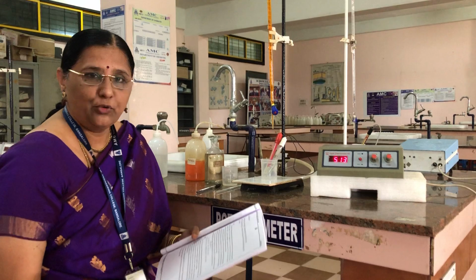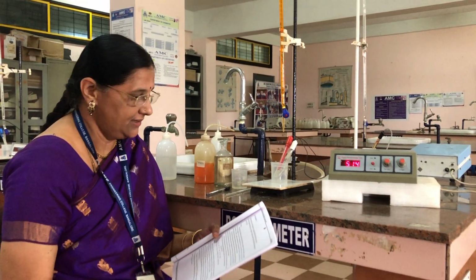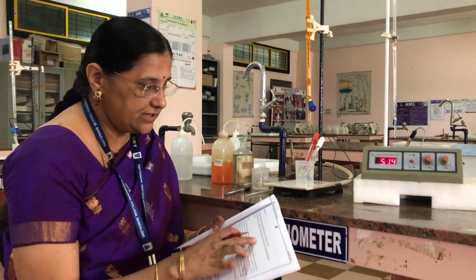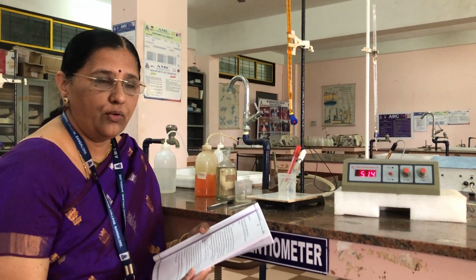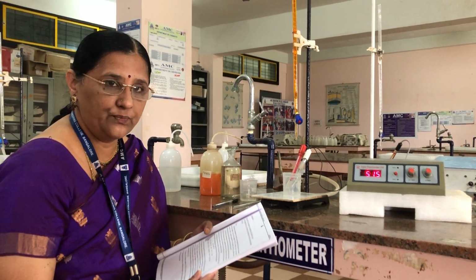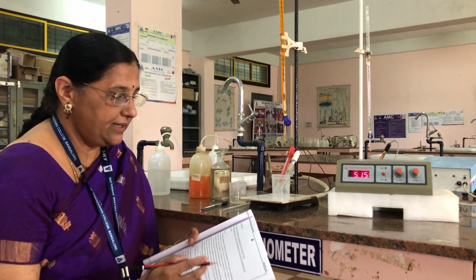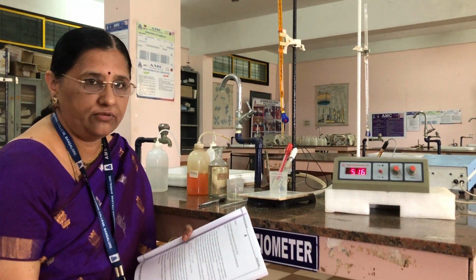Today I am going to demonstrate to you the second instrumentation experiment, that is estimation of FAS potentiometrically using standard potassium dichromate solution. One request to all the students, when you are listening to the video, please keep your manual with you so that you will understand it very well. Okay? So we are determining estimation of amount of FAS.